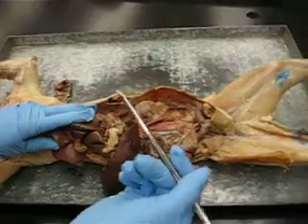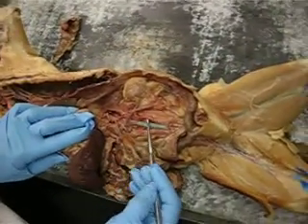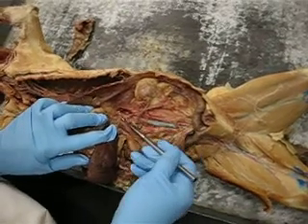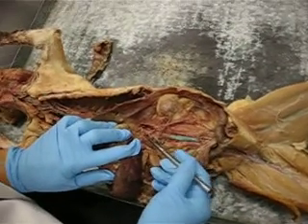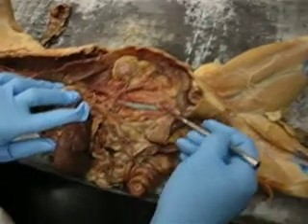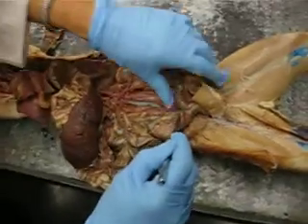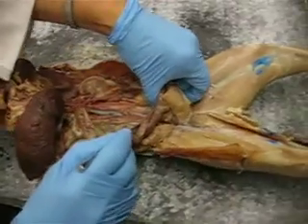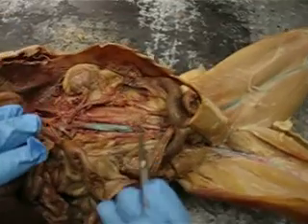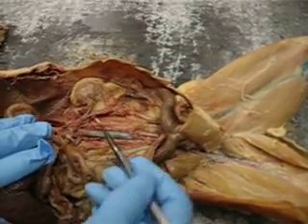I've got to scoot over. It will pass through the diaphragm, and here's your abdominal aorta artery. Coming off the abdominal aorta artery, it's going to be your celiac artery, superior mesenteric artery, inferior mesenteric artery, renal artery, and then it will end at the terminal segment right here. This is your inferior vena cava vein, renal vein.